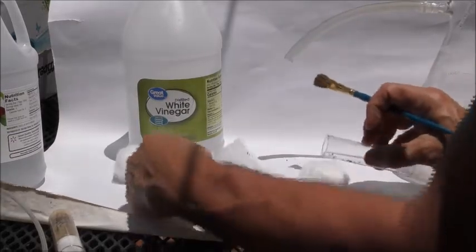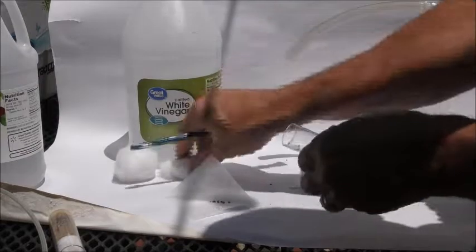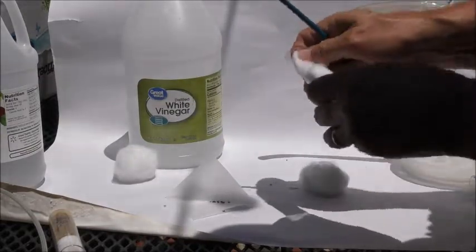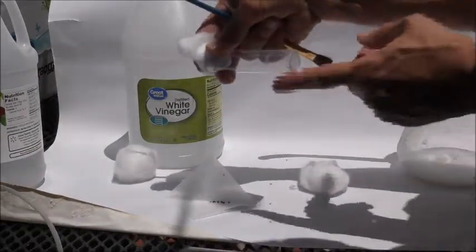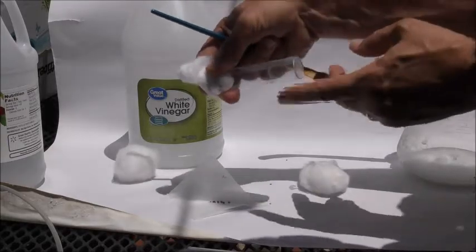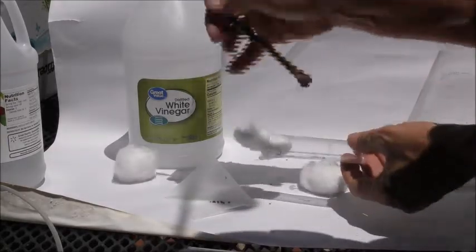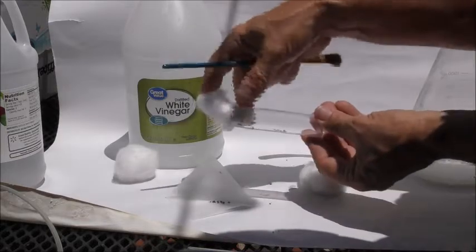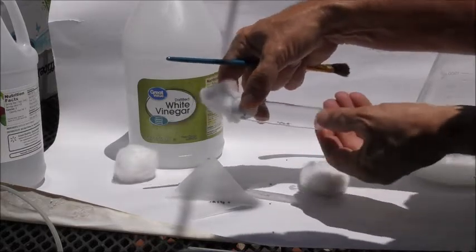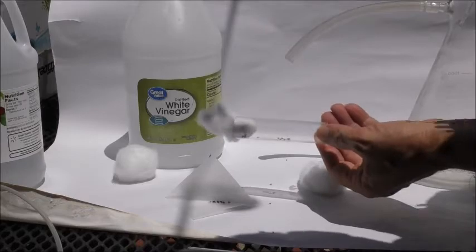Now there's ten, and the others will wake up in time, so you have to work pretty quick. If you put your food in here that you're going to use for your experiment, you might be really careful, put the flies in here and don't let them get down into the food because their wings will get stuck in the food.